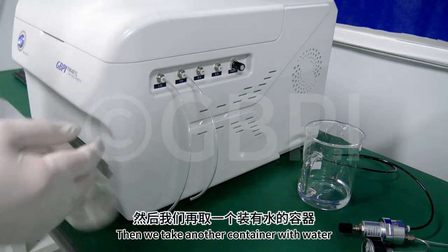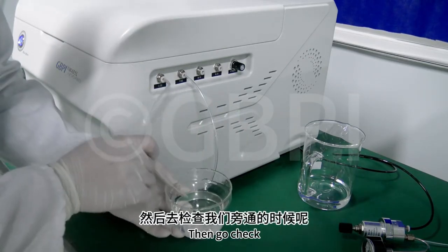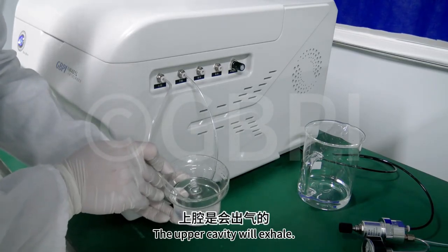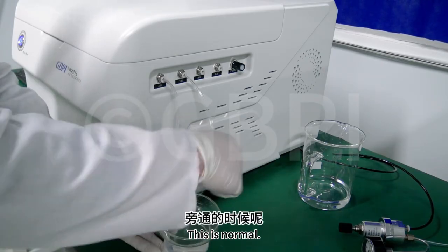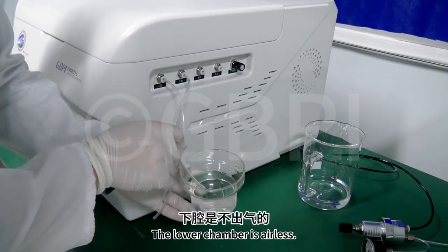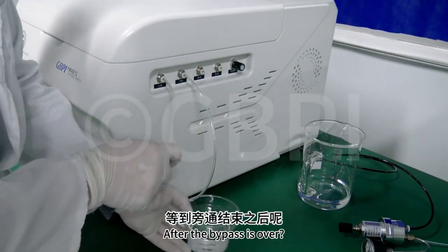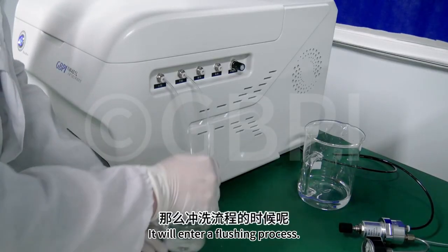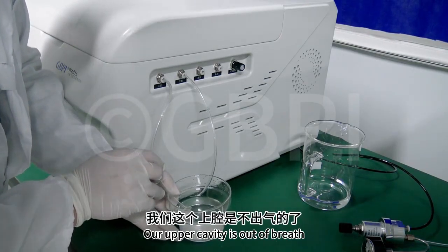Then we take another container with water. Then go check. What about when we bypassed? The upper cavity will exhale. Bubbling was observed. This is normal. What about bypassing? The lower chamber is airless, so it won't bubble. After the bypass is over, it will enter a flushing process. What about the flushing process? Our upper cavity is out of breath.